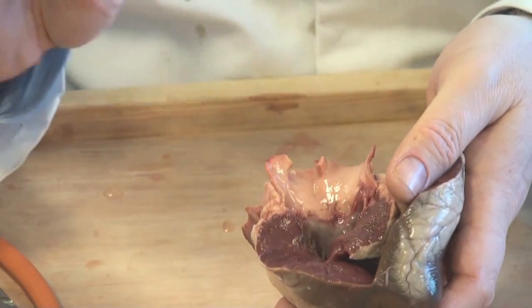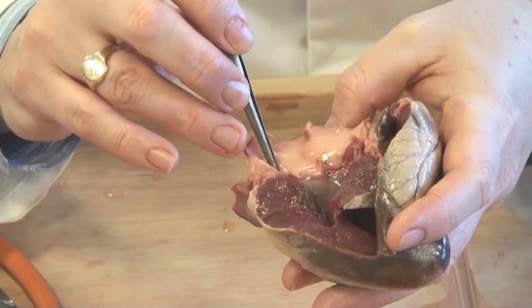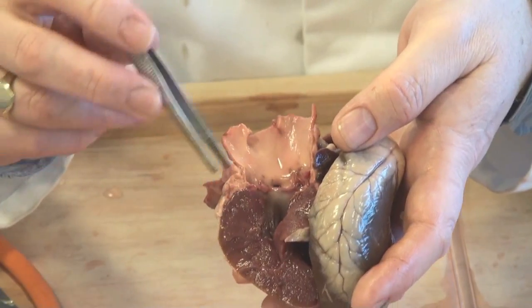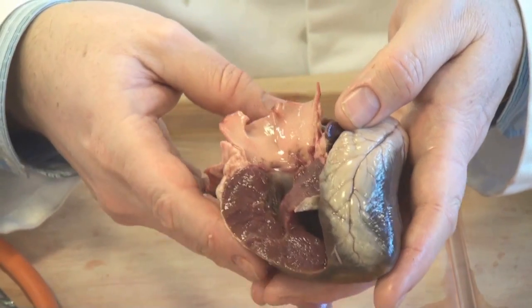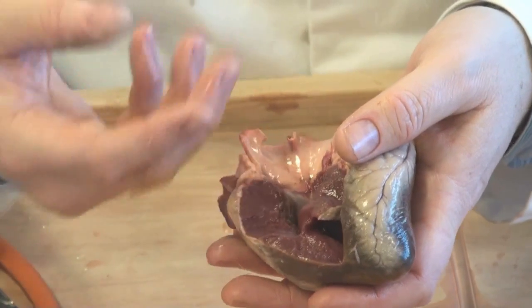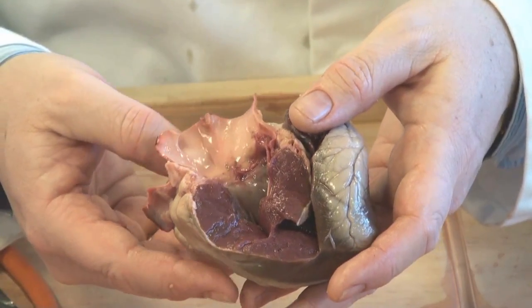This is something I really think it's important to show learners when they're learning about the heart — it's a tragedy if we don't show youngsters these things. They're only on the left-hand side of the heart, at the very base of the aorta, and there are two holes here and here: those are the openings to the coronary arteries, the arteries that take blood into the heart muscle itself, supplying it with oxygen, nutrients, and glucose while taking away carbon dioxide. You'll be talking about poor diet, smoking, and other risk factors associated with coronary heart disease — which is about blocking these arteries — and all youngsters need a chance to find out what those arteries really are.